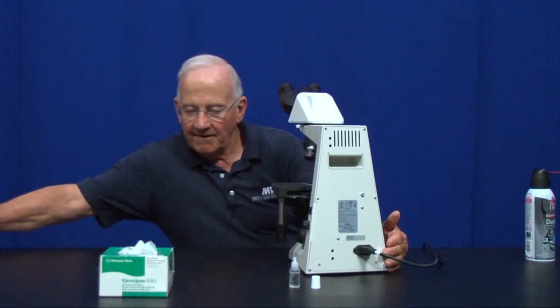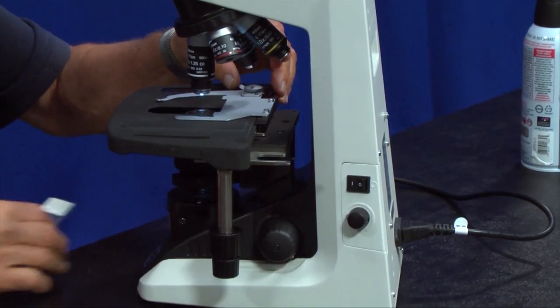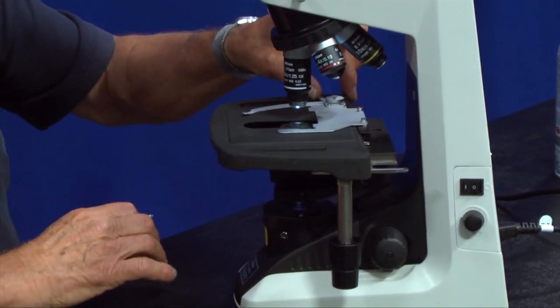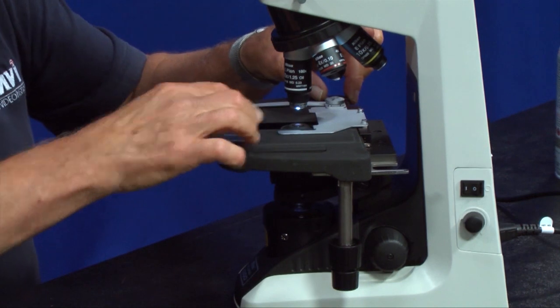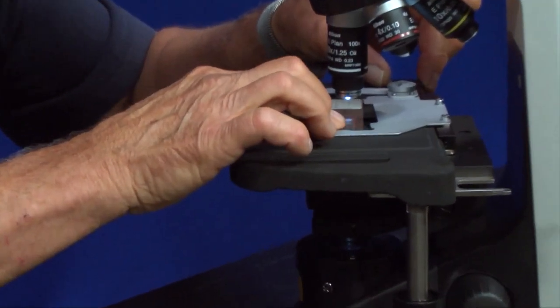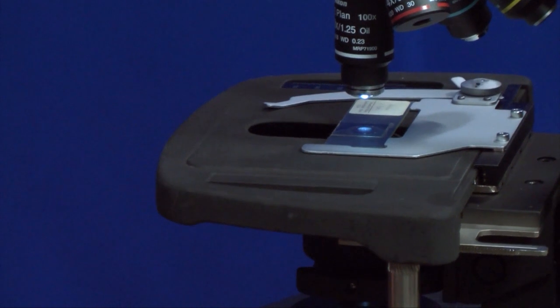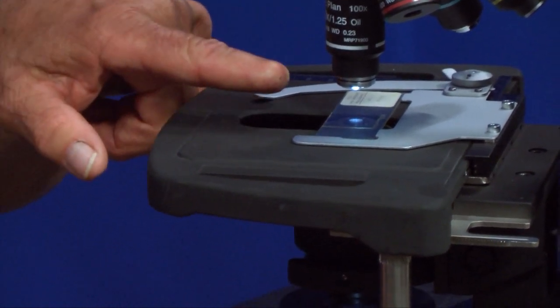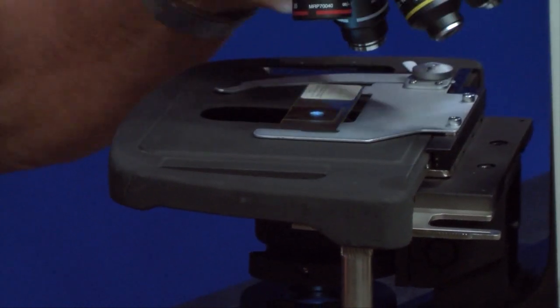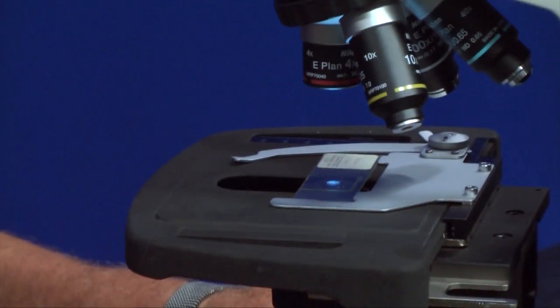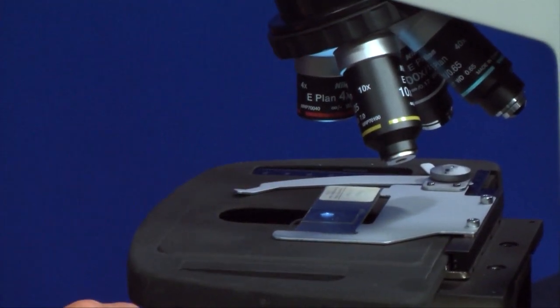Make sure that the condenser on this rack and pinion on the left-hand side of the microscope is racked all the way up. Take your slide, open the finger arm by using the little lever here on the side, and put a slide on. The first thing you should do after you've put the slide is make sure that the cover slip is right underneath the objective, starting with the 4x objective, which is the shortest objective on the microscope.